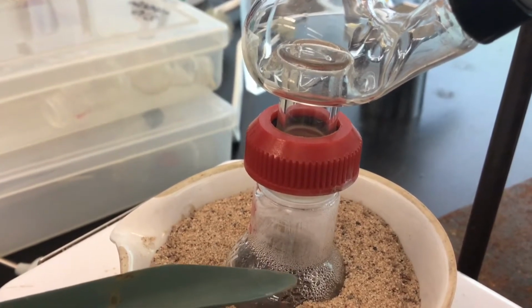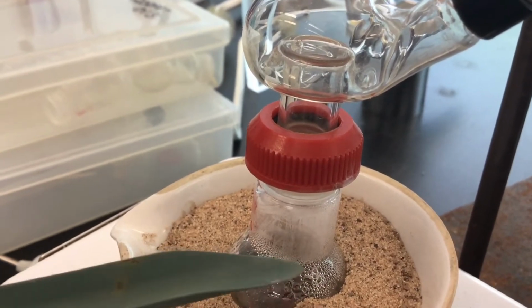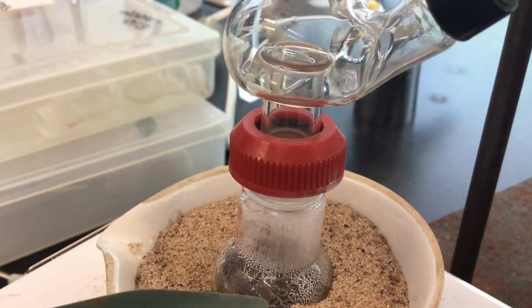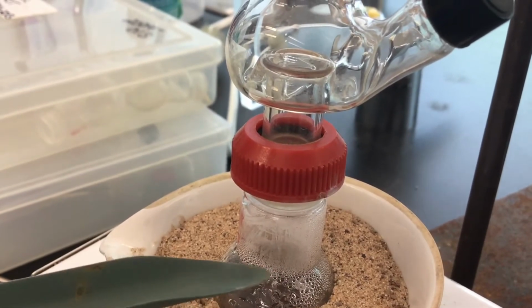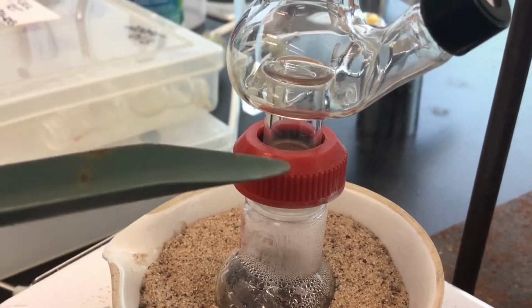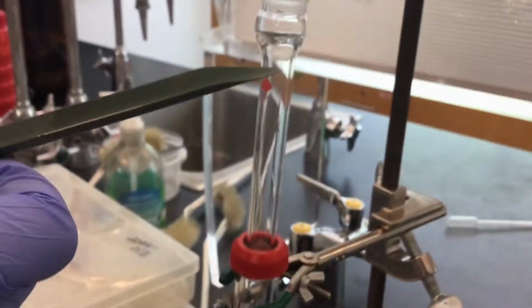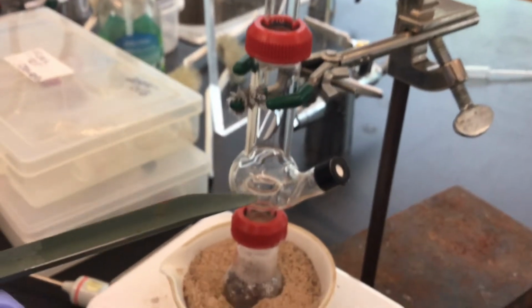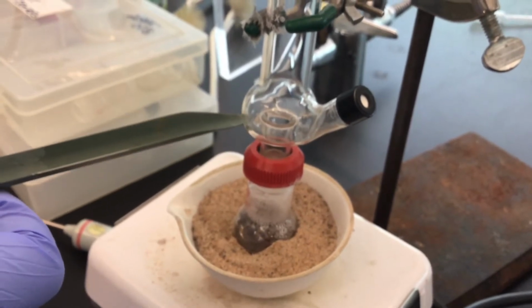Right, this is part of the distillation process. We're going from liquid to vapor and then from vapor to liquid. The steam is going to heat this part of the glass so that the steam won't condense on it anymore, because it's going to be the same temperature as the steam itself. So it has to heat the glassware as it's traveling upward, and then finally reach an area where it's cool enough, for example, all the way up here on the air condenser, where it will condense, come back down, and then it's going to pool here where we're going to collect the distillate.